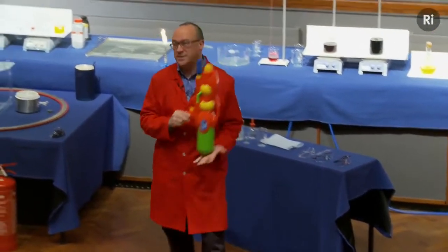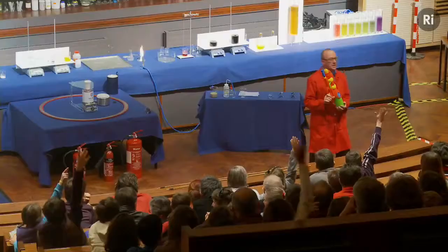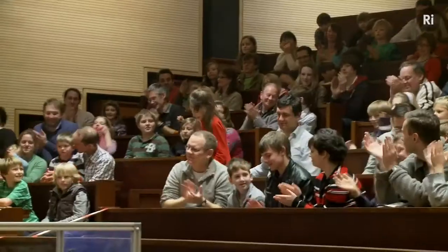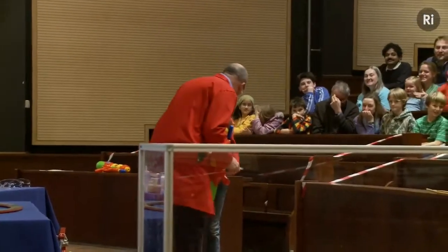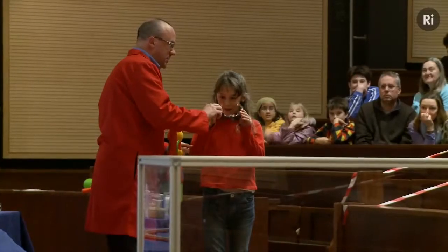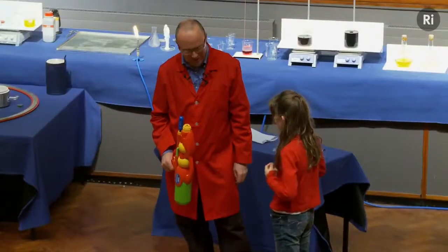So could we use this to start a fire? Well, for this I'd like a volunteer, please. Who would like to volunteer? You were very quick. Let's have a hand for our volunteer, please. And what's your name? Kiara. Kiara. Right, Kiara, if you'd like to put on these safety goggles. They're special safety goggles because they're tinted. They're nice trendy shades.